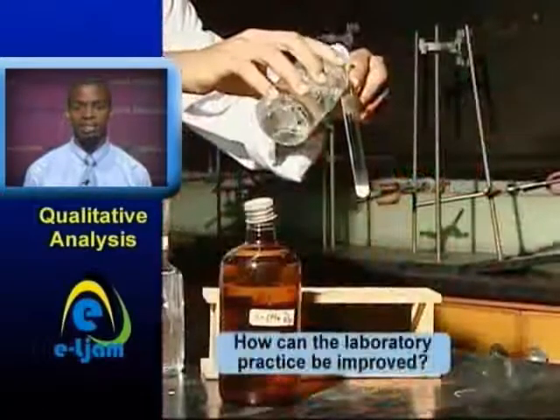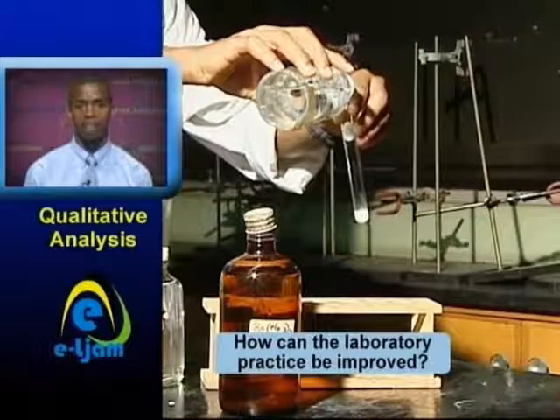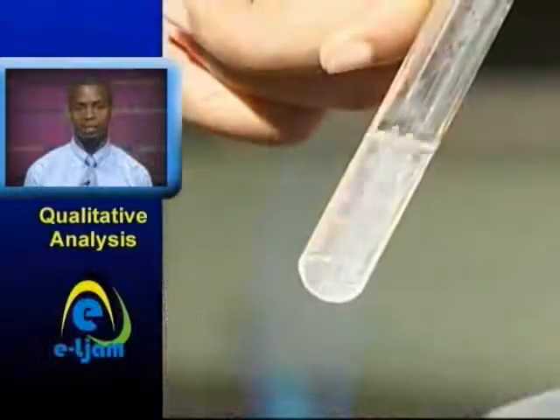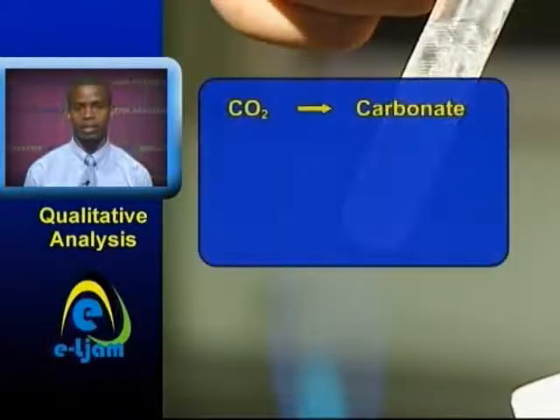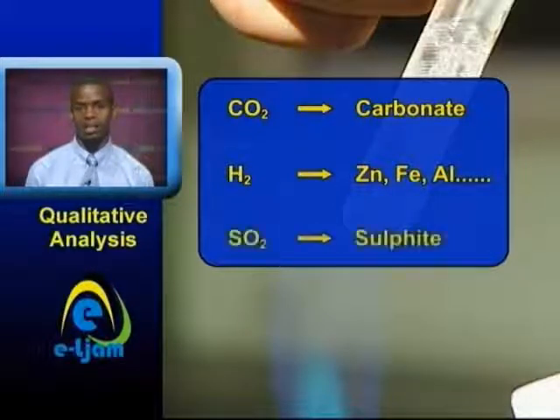A little dilute acid, usually hydrochloric acid, is added to the test substance, and if no reaction occurs in the cold, the mixture should be warmed gently. The evolution of carbon dioxide indicates the presence of a carbonate. The evolution of hydrogen indicates a metal above hydrogen in the reactivity series. The evolution of sulfur dioxide indicates the presence of a sulfite.